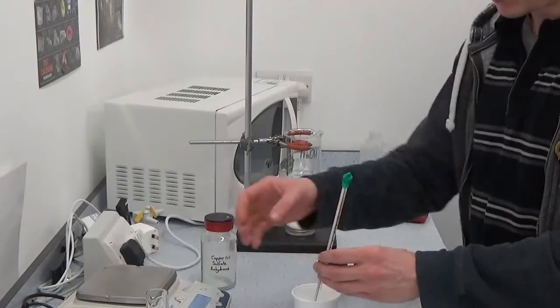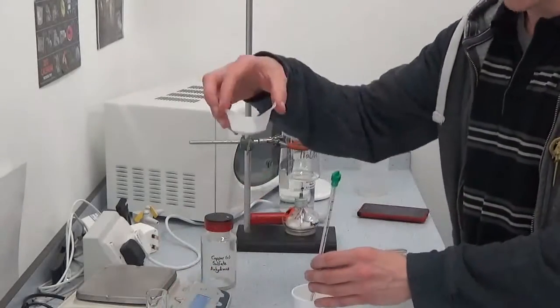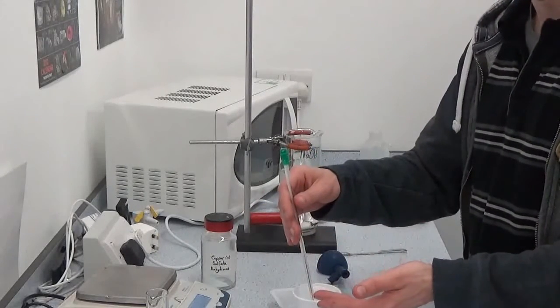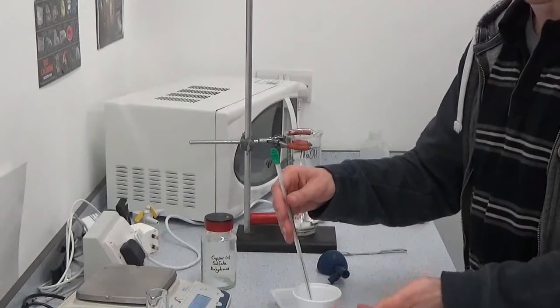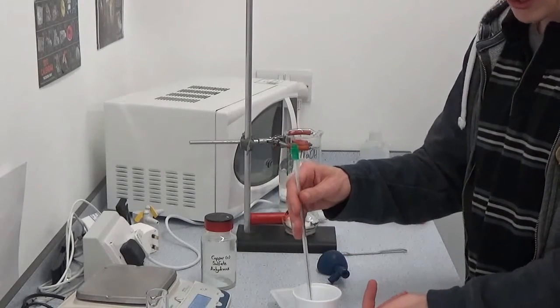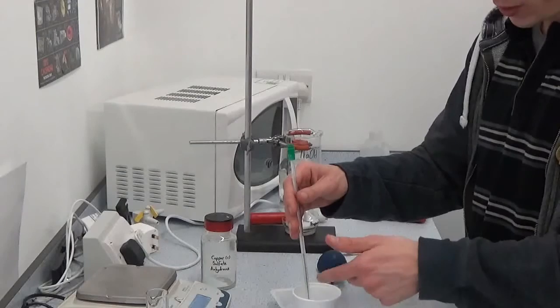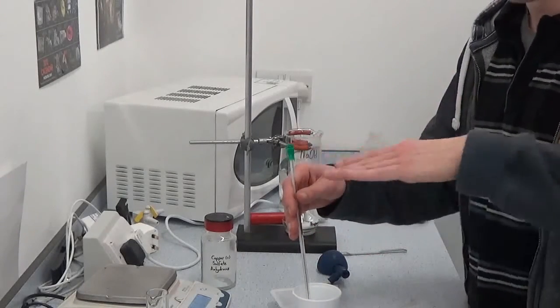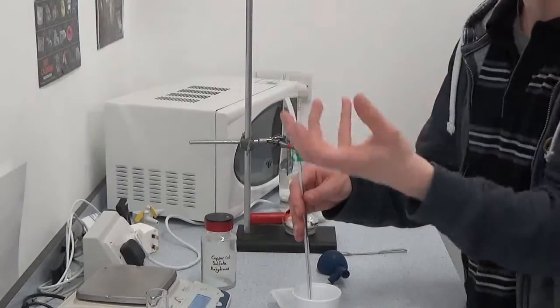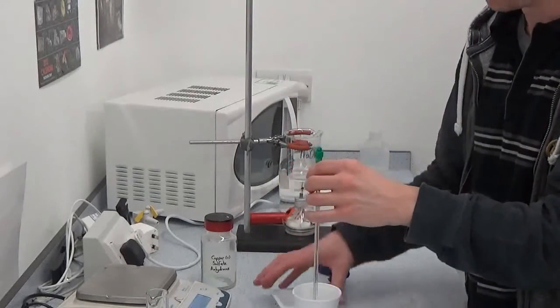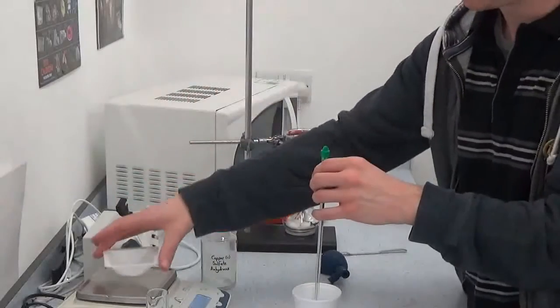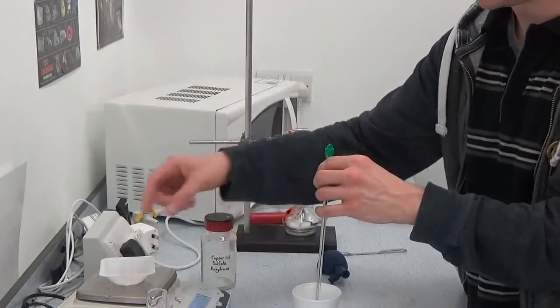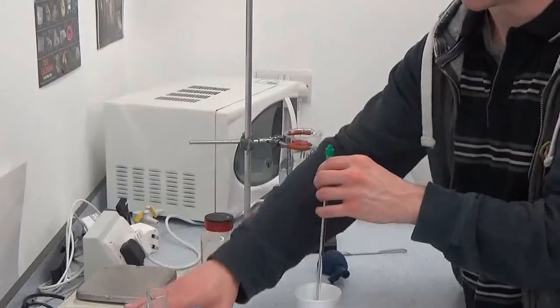So at the fourth minute what you would do, you take your solid, you chuck it in. Don't record the temperature at the fourth minute, the reason why is it needs a little bit of time for the actual solution to heat up the thermometer. The thermometer will be rising, so at that fourth minute it will be climbing, you'll not be able to record it accurately. Record the weight of your boat, so the difference between now and what you recorded earlier is the amount of solid what you added.